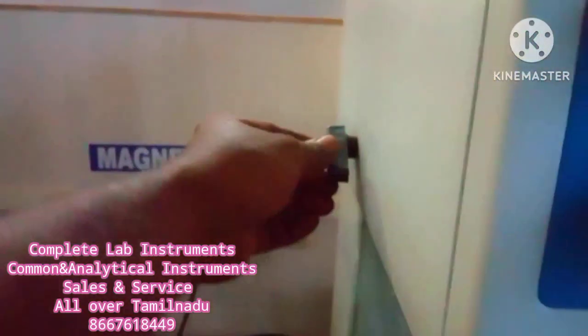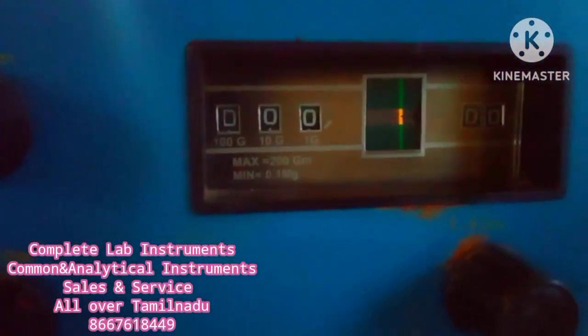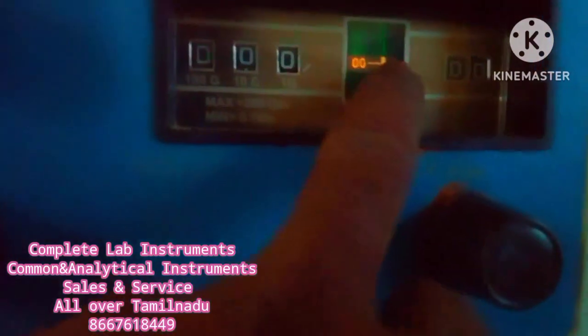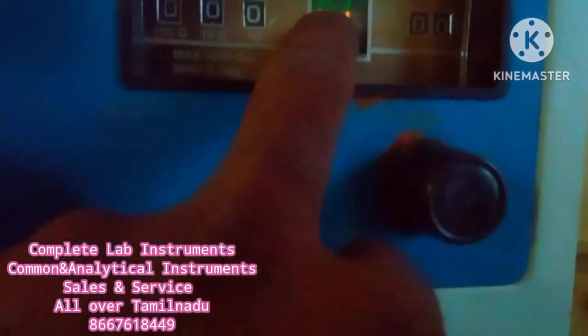Press the button to adjust. Make sure you press the button on the left side, then press the button again.